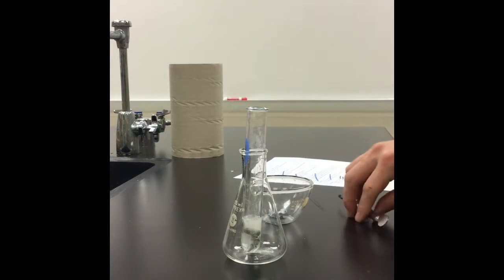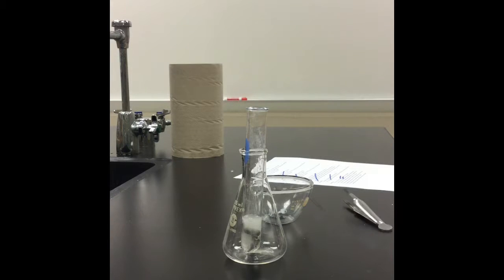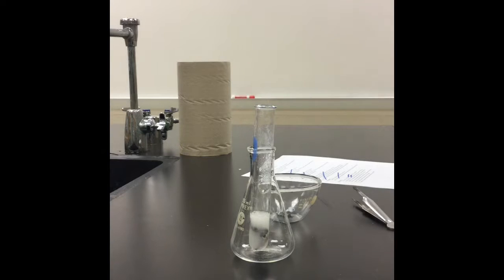And you guys notice that it's starting to bubble. So we see bubbles forming. So we are releasing a gas as this reaction proceeds. Since this was reacted for a little while, we want to bring a flaming splint to the top of the test tube. This is a test for a flammable gas. So if we're producing a flammable gas, we should see some ignition here. Maybe even a loud noise.